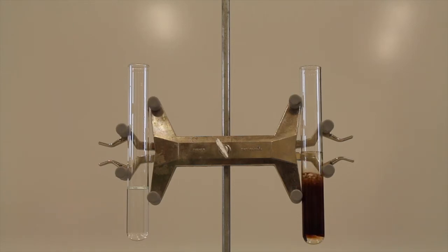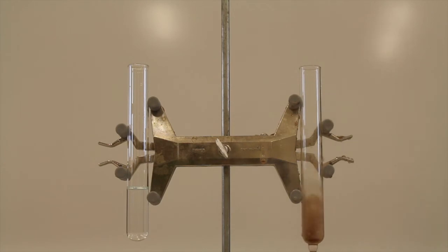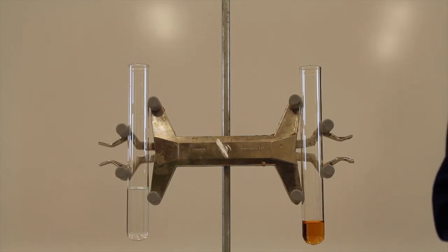You can start to see that the reaction is becoming more vigorous as it's starting to actually move up the test tube. And you'll start to see that there's a small amount of bubbling continuing in the test tube due to the breakdown of the hydrogen peroxide. However, it is relatively stable now due to the reaction being essentially complete.